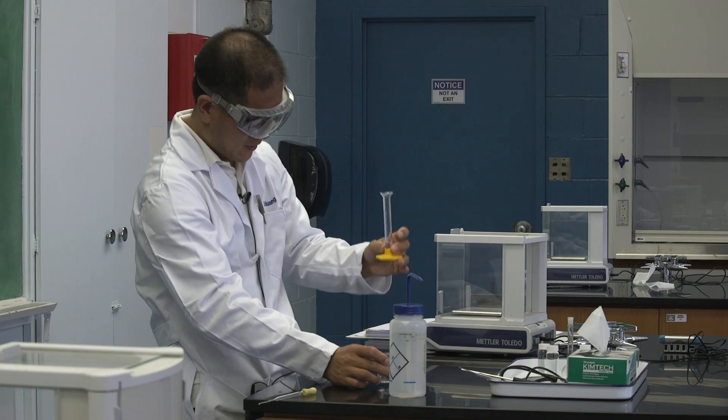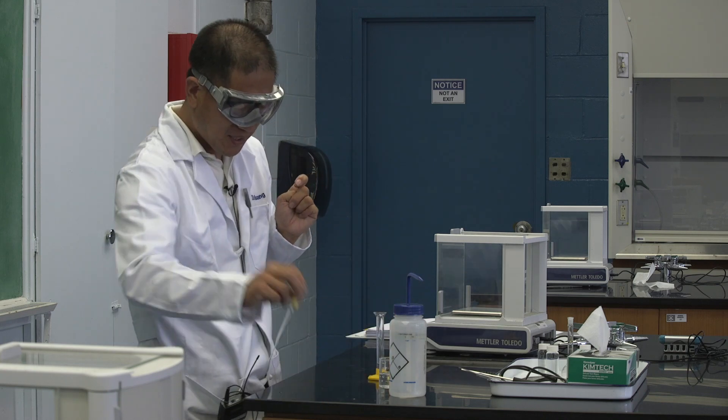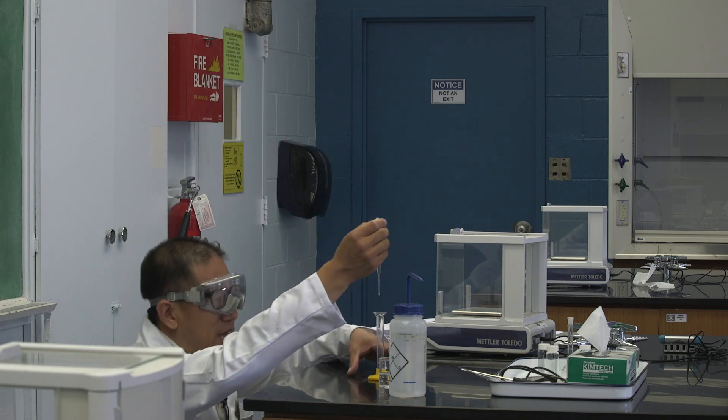Let's try to add to the 2 milliliter mark. No, I add too much. And this is time to use this dropper. If you add too much, you get something extra out.